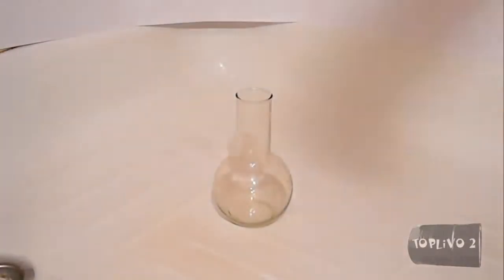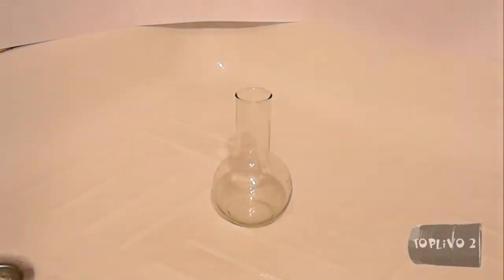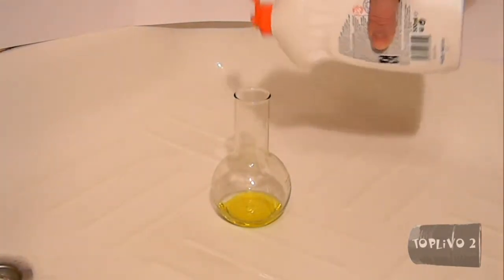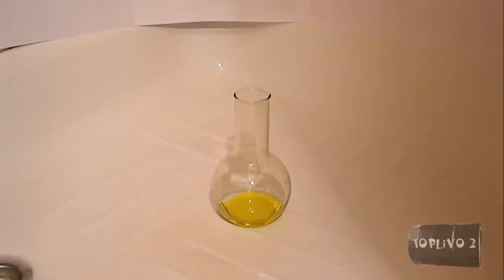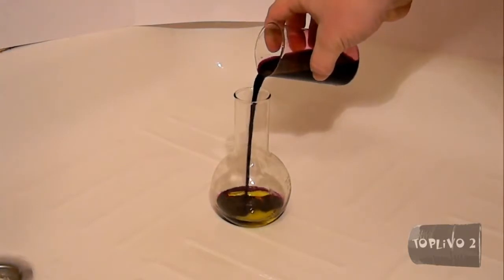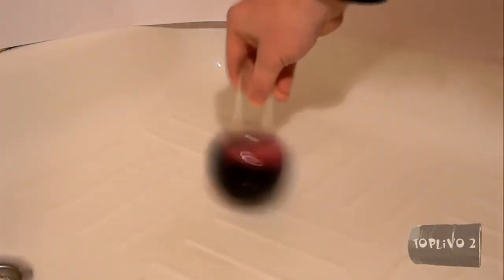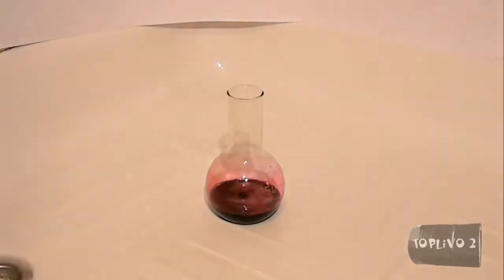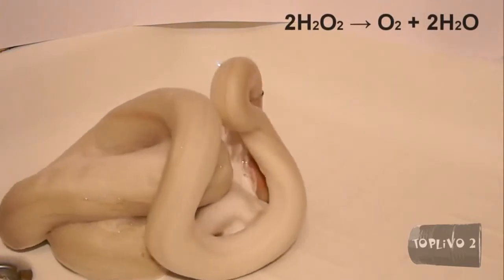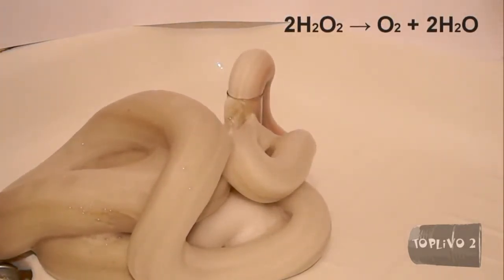To make the decomposition of hydrogen peroxide even more spectacular, let's make the following mixture. Pour about 20 ml of liquid soap into the flask. Then add the catalyst — in this case, the solution of potassium permanganate. Now we pour in the hydrogen peroxide. Hydrogen peroxide decomposes to release a gas that expands into a nice foam.